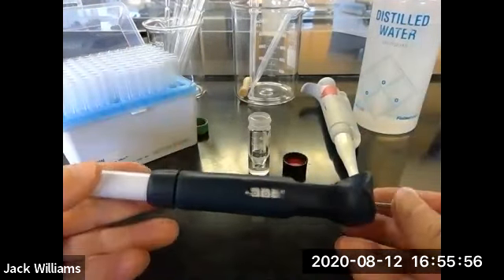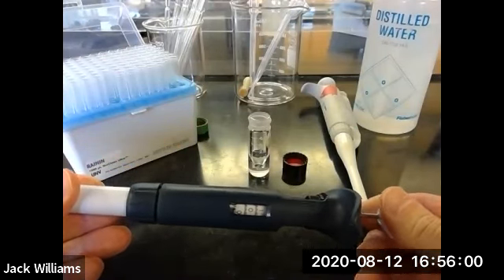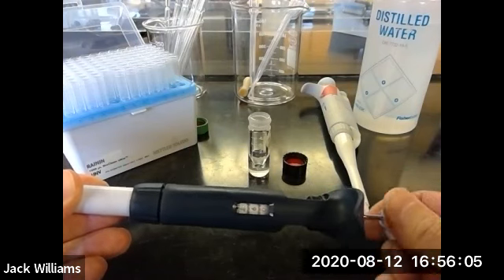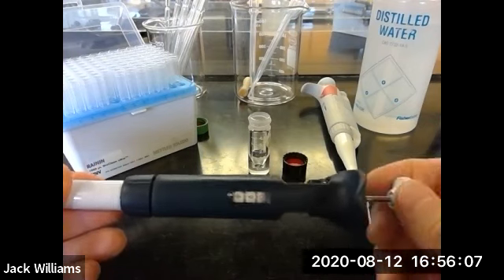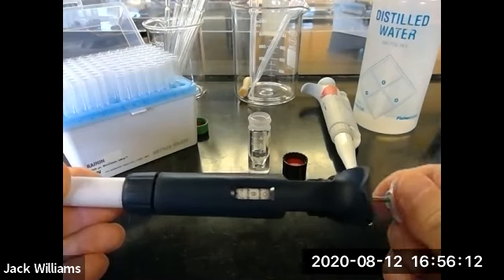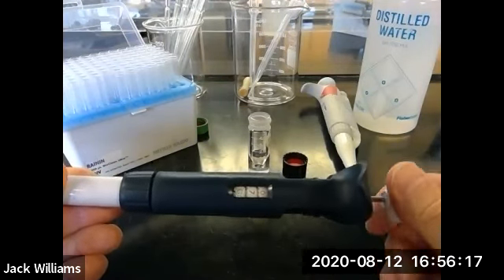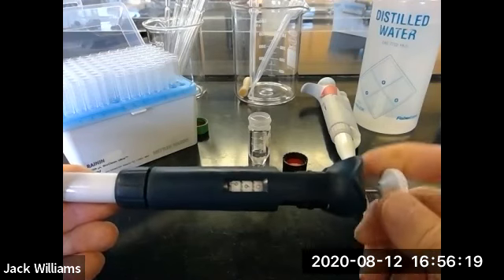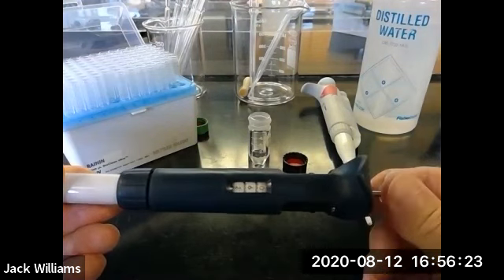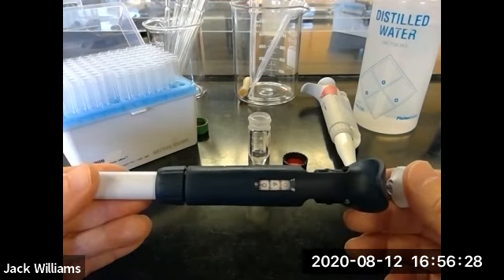So the first thing you're going to have to do is set this and make sure you go the right direction. That's 990. And carefully, don't go spinning things around. You always take your time, work carefully. So you're going to have to set this to 600 microliters. Cool, there it is. That's not 60, that's 600.